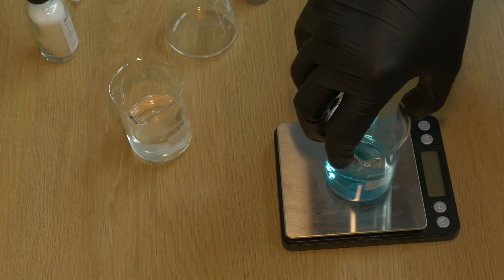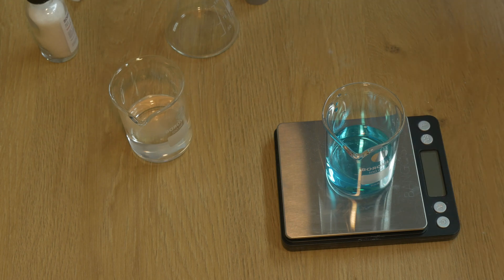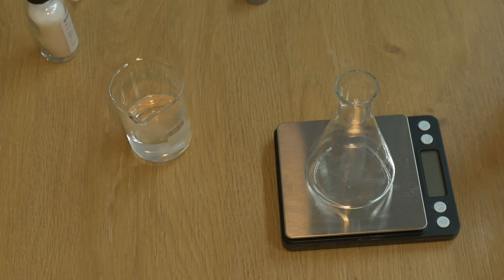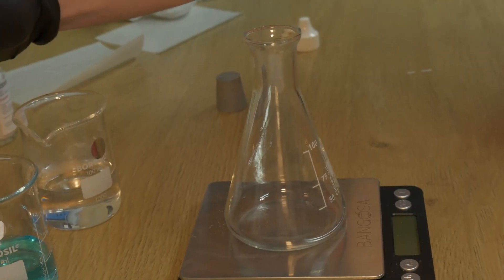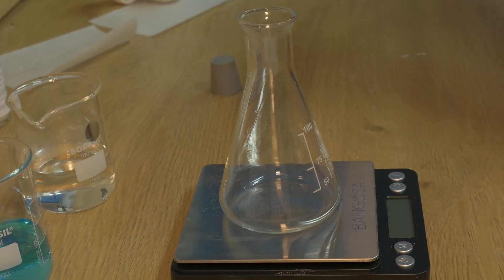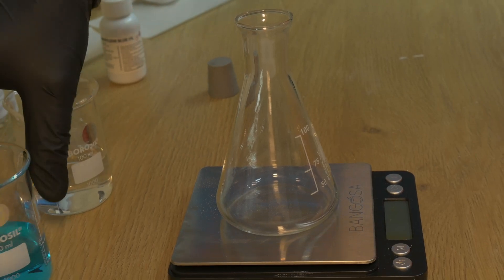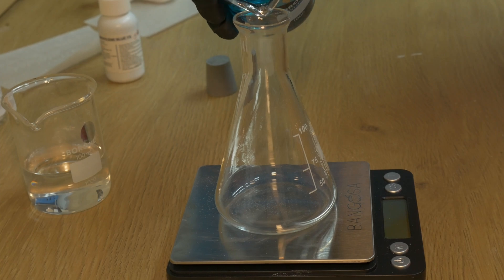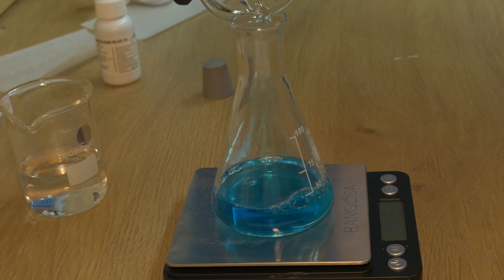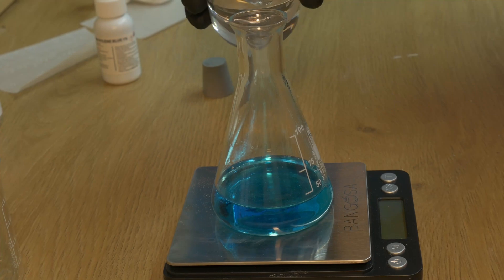So let's put it to the test. If the above is right, glucose will work and sucrose will not work. The blue bottle experiment is a well-known redox reaction — a chemical reaction where oxidation and reduction occur simultaneously involving the transfer of electrons. It demonstrates reversible oxidation and reduction using methylene blue, a dye that changes color based on its oxidation state, an alkaline solution with a pH greater than 7 often containing sodium hydroxide, and a reducing sugar such as glucose.